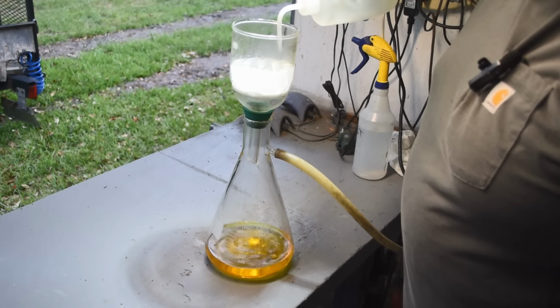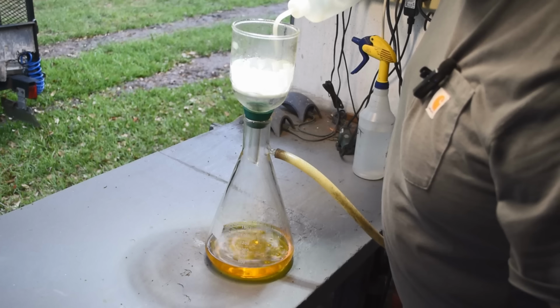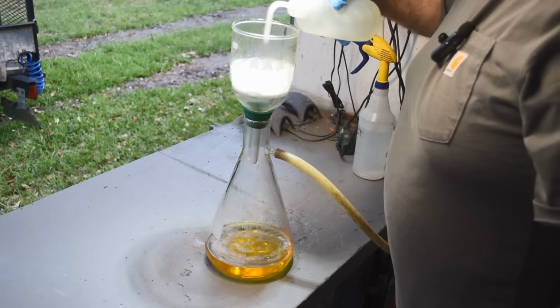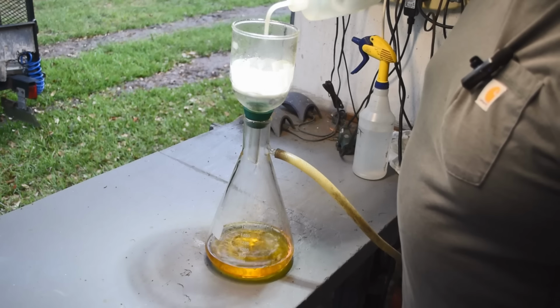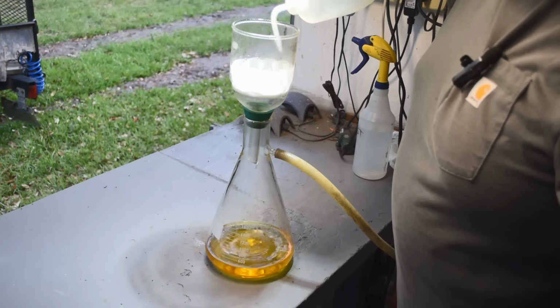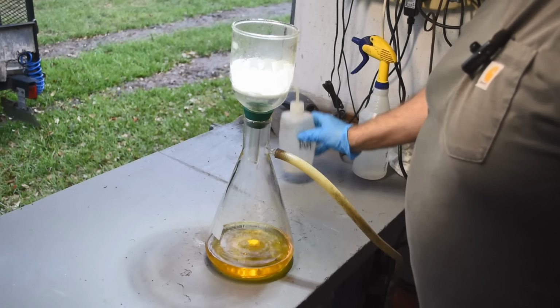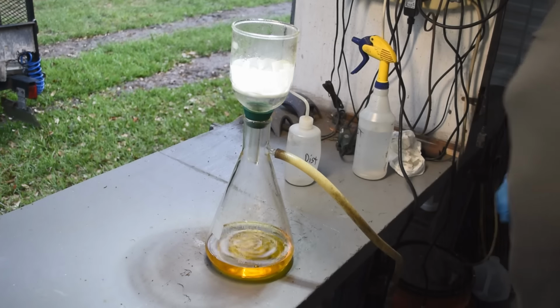Yeah, we'll get all the color out of the filter. That yellow color, gold, so I want to try and get as much of it out of there as I can, though I am going to save the filter in Yanni's rag and filter bucket. We'll incinerate this one day and see what we can extract from it, along with all his other filters and rags. All right. We'll let the pump pull the water through, and I'll give you a look at that filter.